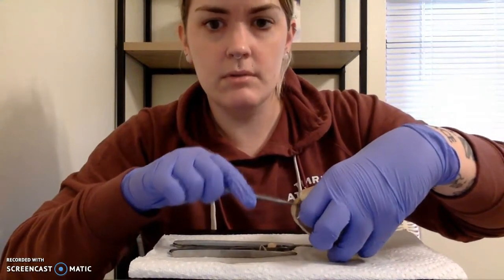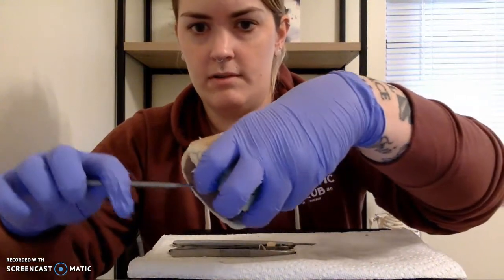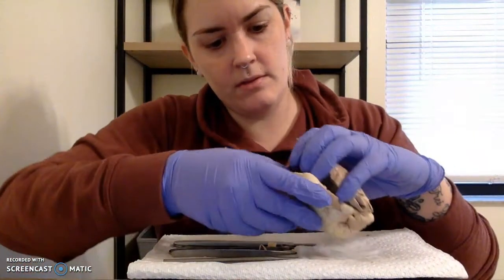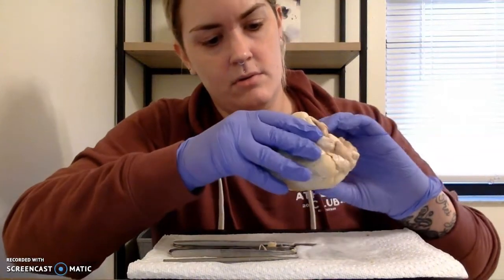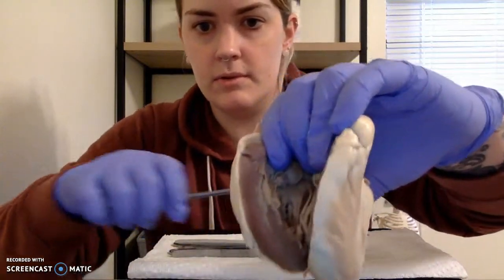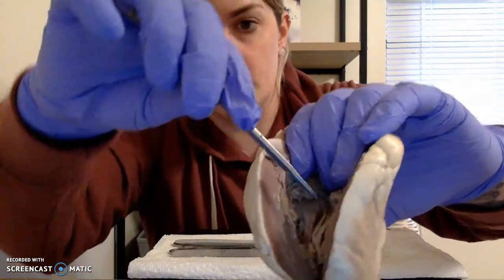This is the muscle of the heart. Perfect. This purplish layer, and then our endocardium is going to line the inside of the ventricles. I'm going to open this up all the way here so you can see the lining of that ventricle. It's actually here and here.